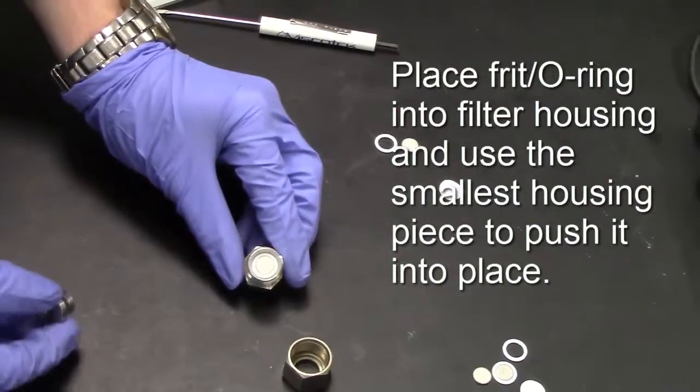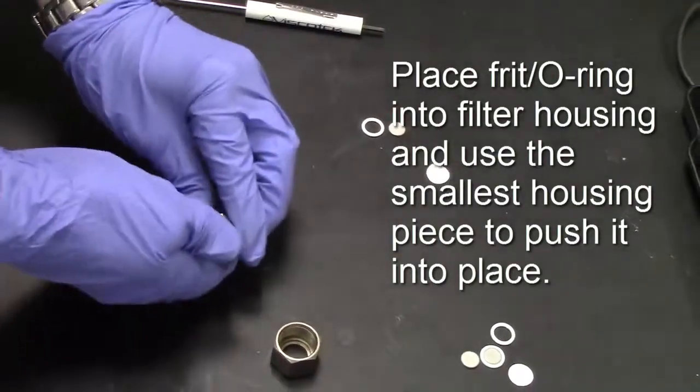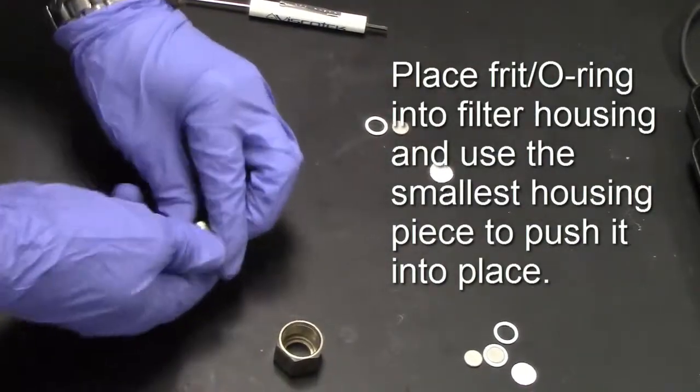Then, place this piece into the filter housing unit and use the smallest housing piece to push it into place.